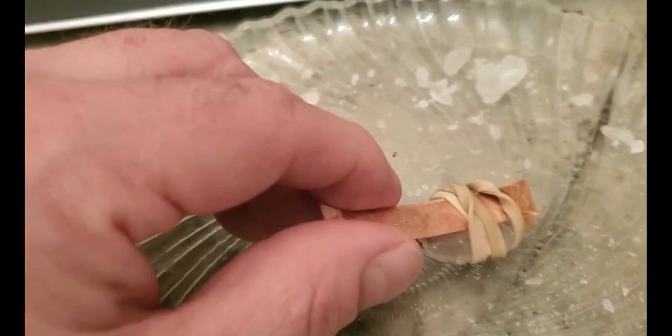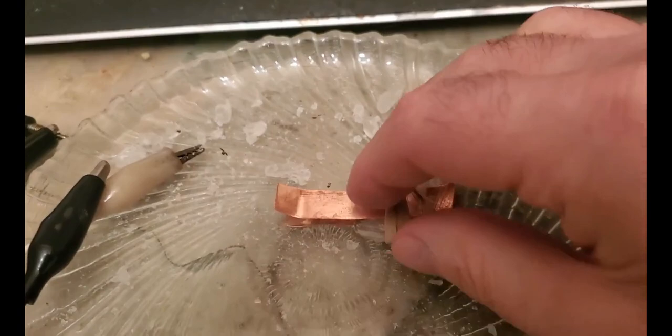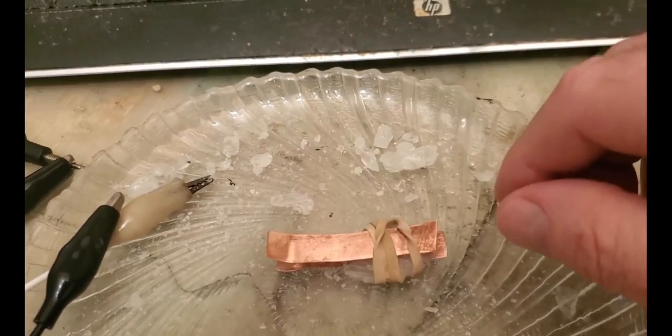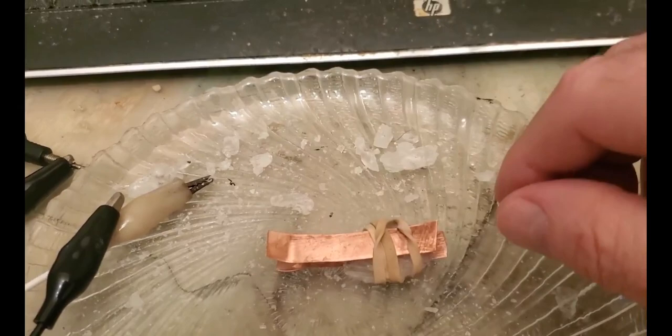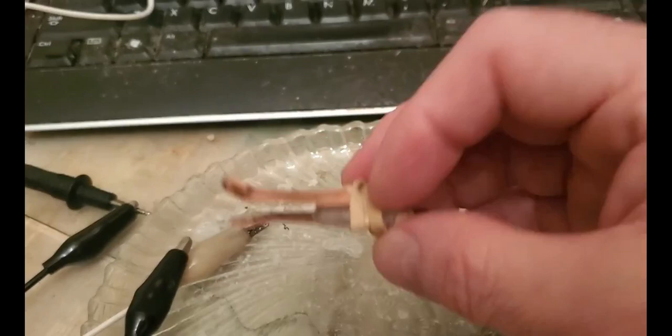Let's just see what we got and see if we can observe any piezoelectricity or ferroelectricity. I think that one's pretty much a single crystal — another good one I dug out of that mess. I put it between just two plates of copper. One idea is to take all of this material, put it in a blender until you have a powder, and use the powder — because unless the crystals look perfect you don't have good surface contact, and I don't know if that's important.